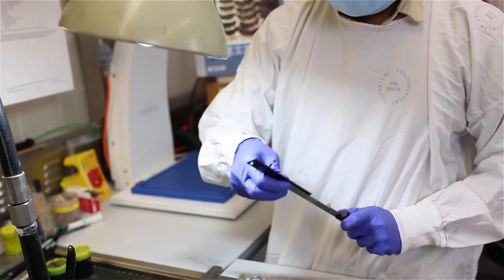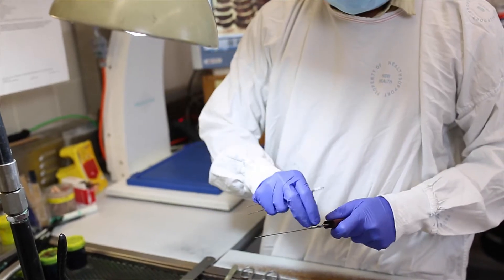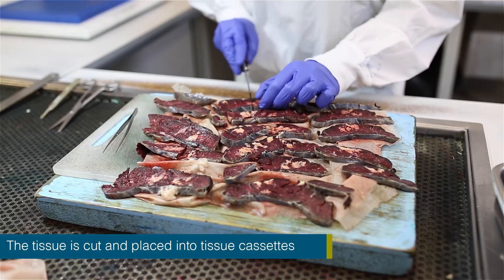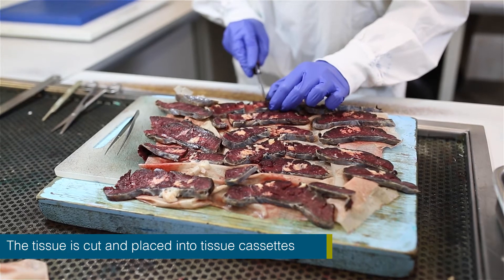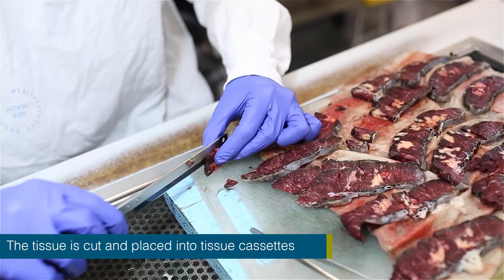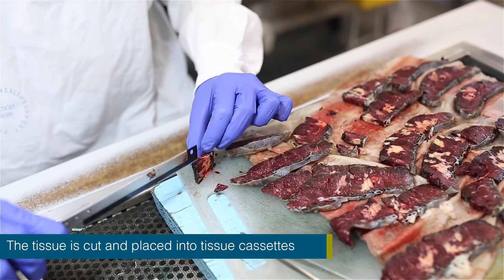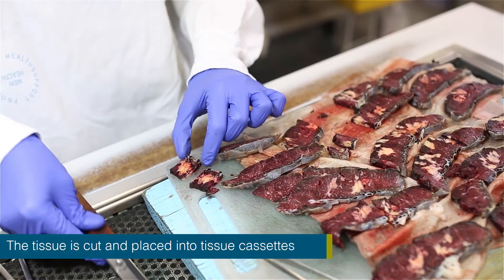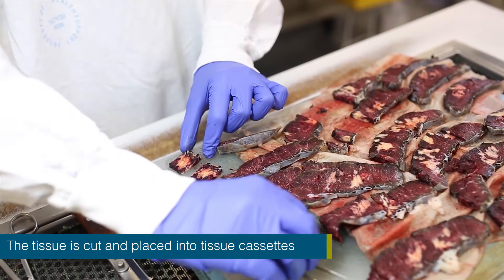If the tissue sample is small, then generally the entire specimen is submitted for processing and microscopic examination. However, if the specimen is big, then only selected but representative abnormal areas are submitted for processing.